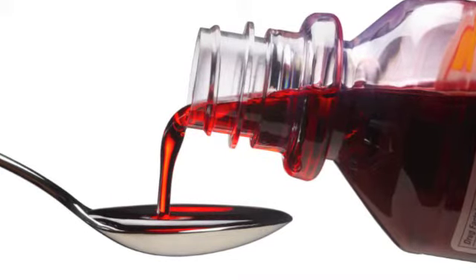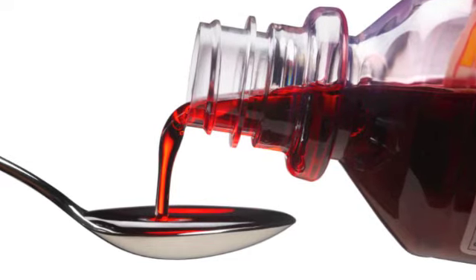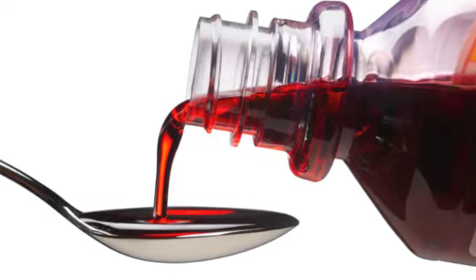We were commissioned by the FDA to determine whether a new cough syrup was using an illegal food dye. We did this by running the cough syrup dye on our chromatography paper. Using chromatography, we were able to determine that the food dye in the cough syrup was made of a blue dye, which was legal, and a pink dye, R3, which is illegal.